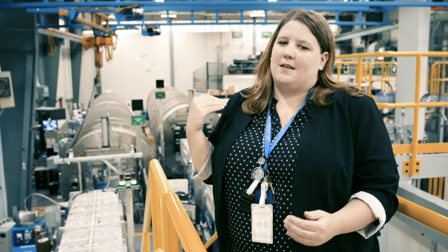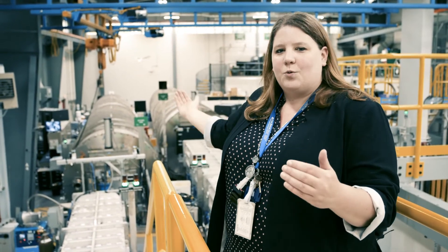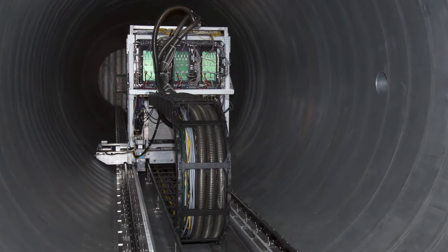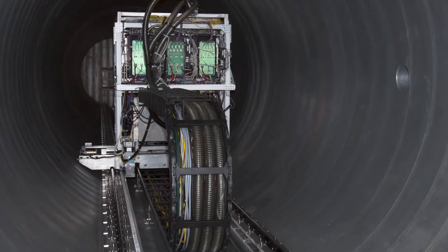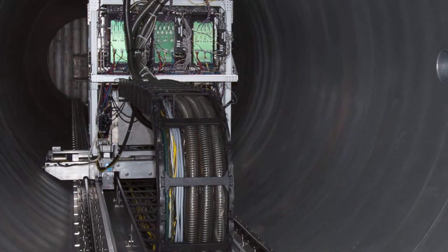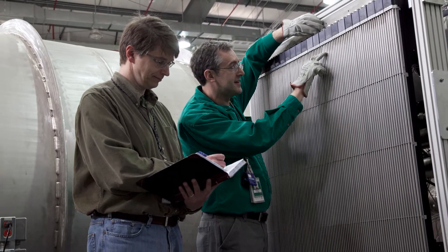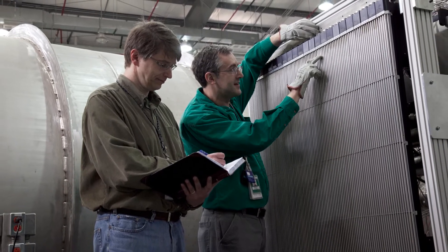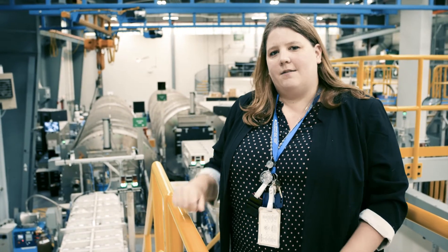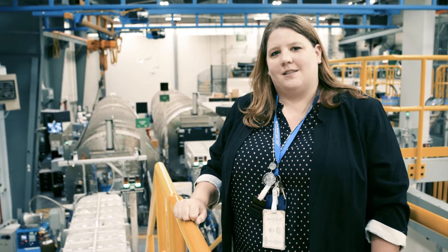From there we see the most prominent feature of a SANS instrument, which is this 20-meter long detector tank. Inside of it is a one-meter by one-meter square tube array of helium-3 tubes that allow us to detect the neutrons. After this we're going to go down and take a closer look at our data acquisition system with Ken.